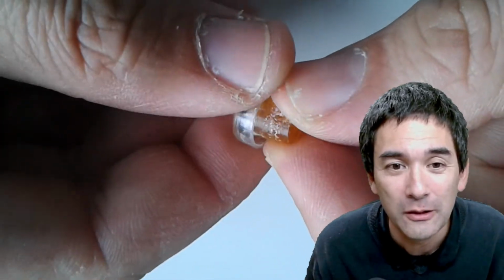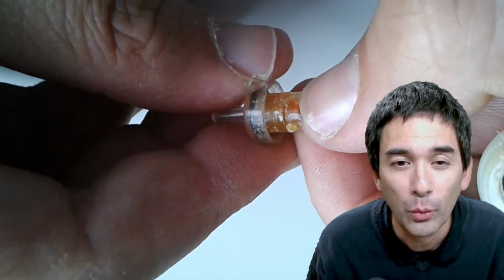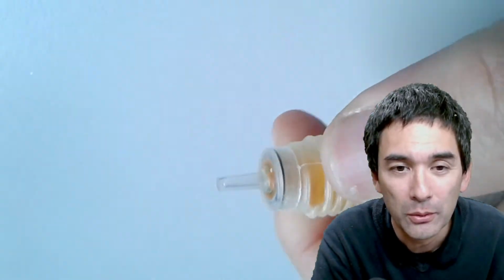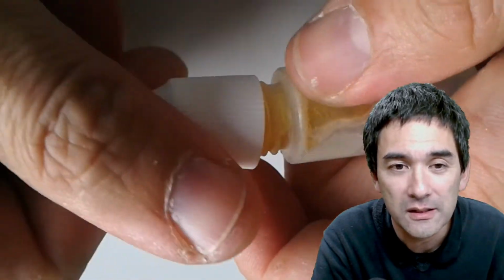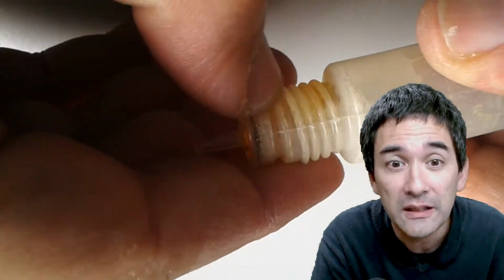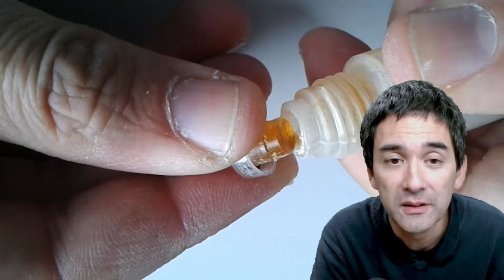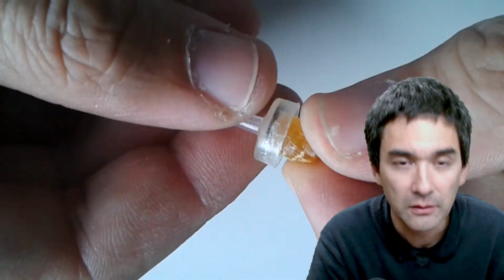It has turned completely hard because there are certain solvents in the oil that have evaporated, and this immersion oil has never been used. This was one of the bottles in school. It tells us that, especially when using natural immersion oils, we have to clean it off. Otherwise, there is the danger that the oil turns solid. But this does not happen with the synthetic immersion oils. Just so that you're aware of.